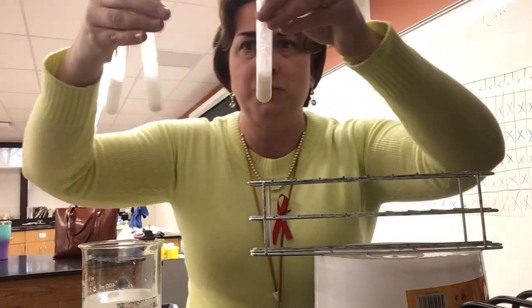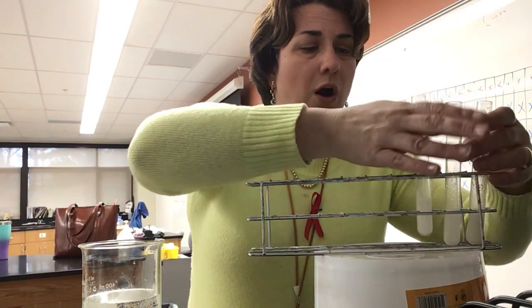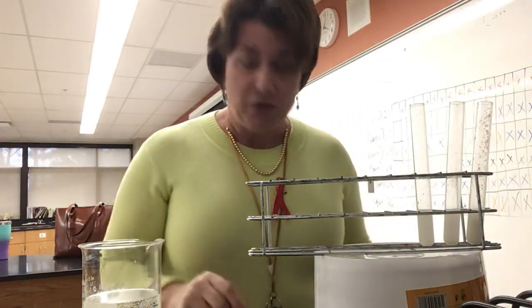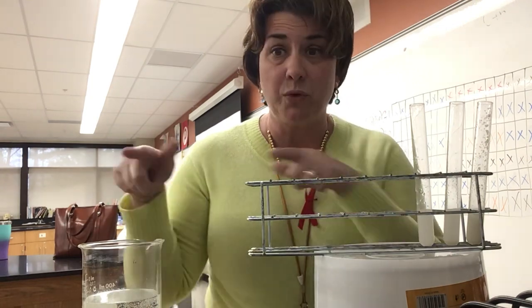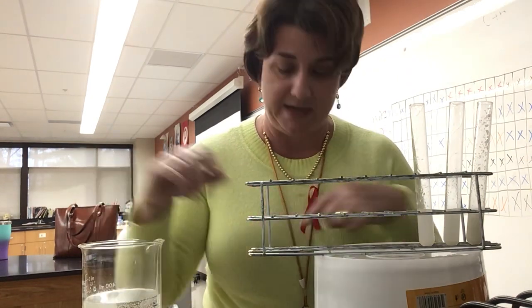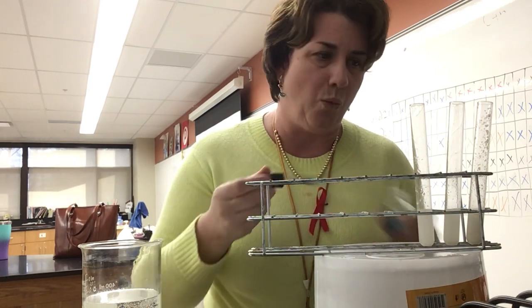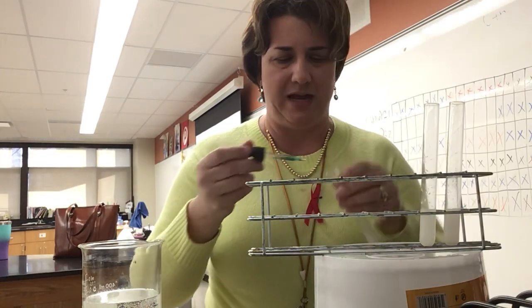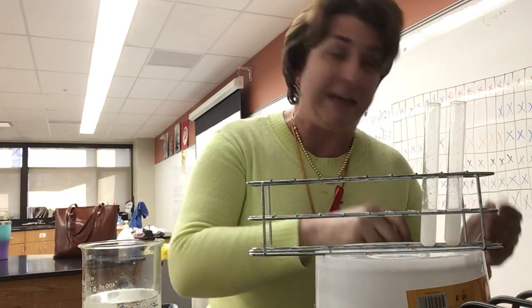I have 3 test tubes that are basically the same now, and I'm going to run these through our different tests. So I'm going to get my Benedict's going first. Benedict's requires the hot water, so my water's getting nice and hot right here. To it, I'm going to add roughly 1 dropper full. I might actually add a little bit extra just to make the reaction happen faster, if it's going to happen.